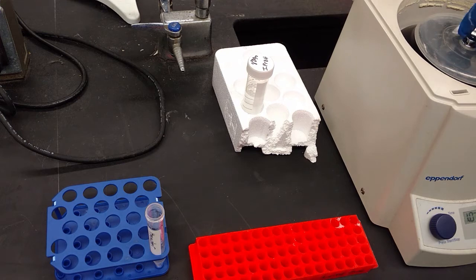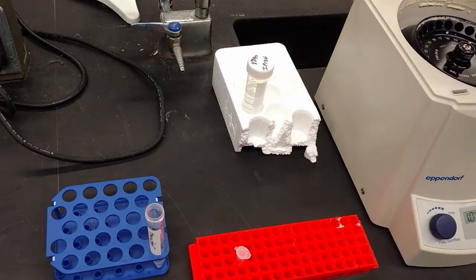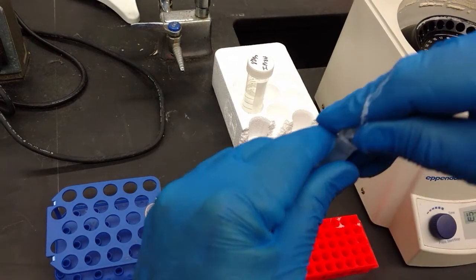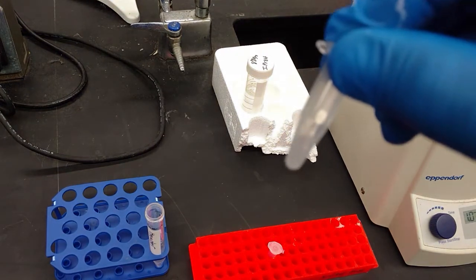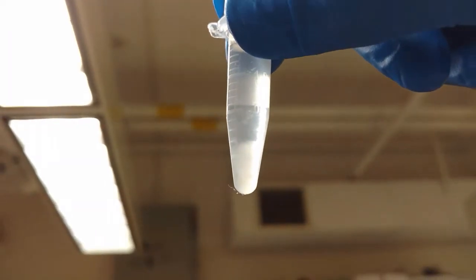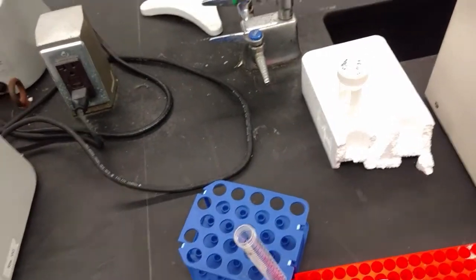And we're back. Centrifuge just stopped spinning. And what do we have here? You want to be gentle because these are not super tight pellets. And if we can see them, what you have here is a pellet. And now what we want to do is we want to pull the liquid off from on top of the pellet.